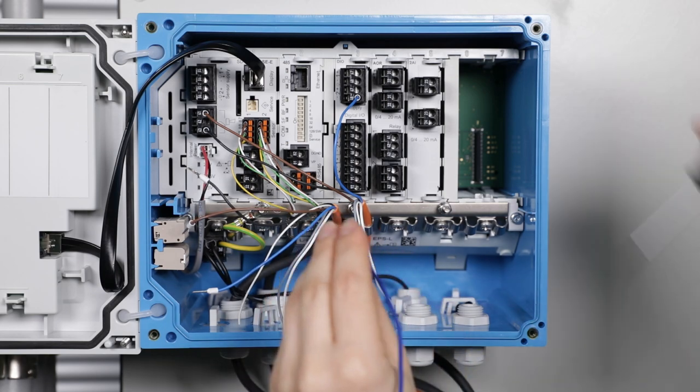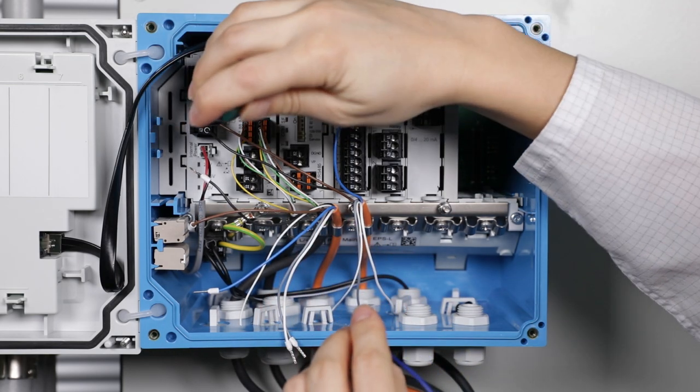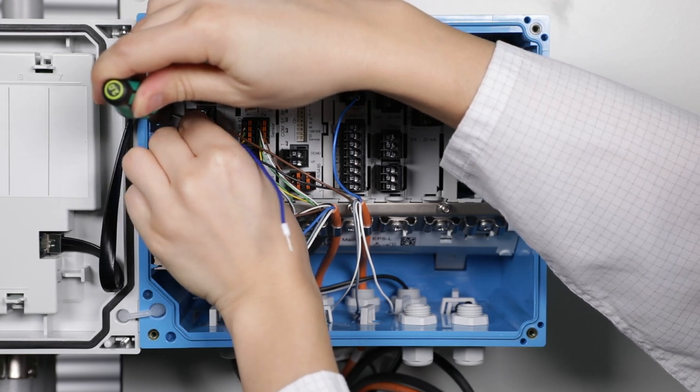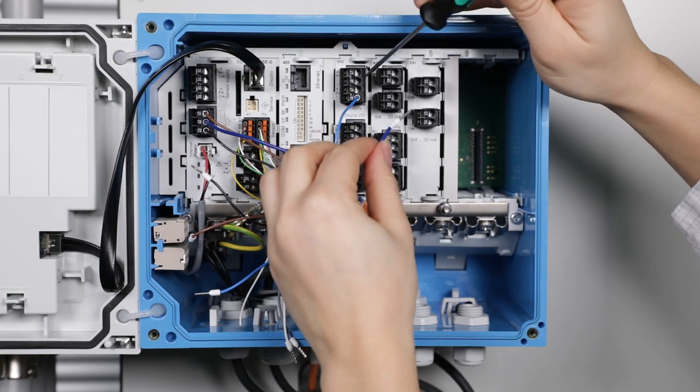Then I need the connection cable from the alarm relay to the power supply.